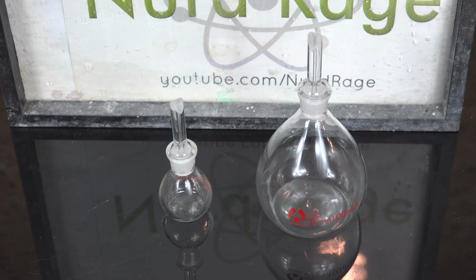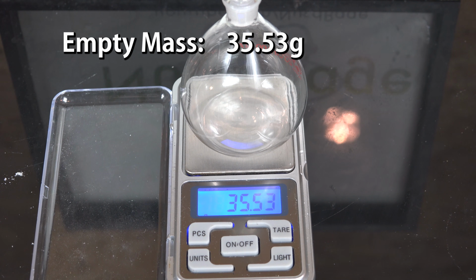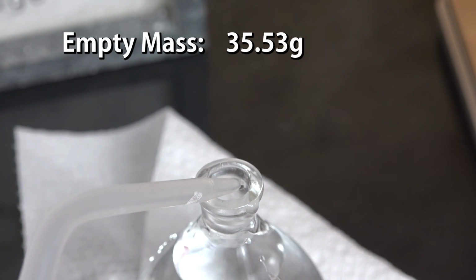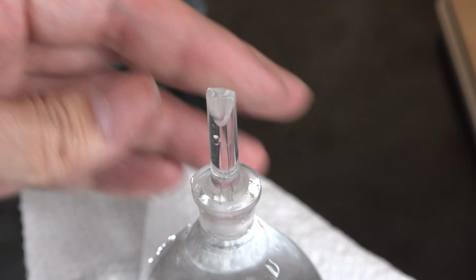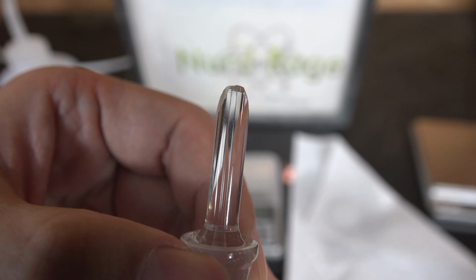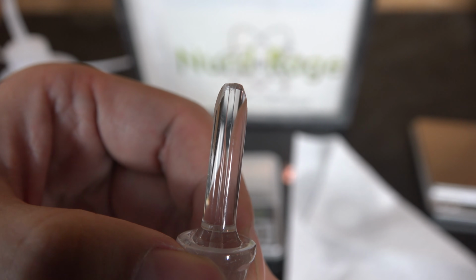To calibrate it, we're going to measure the volume ourselves using the mass of a liquid of known density. We first weigh the pycnometer, including the stopper, completely dry and empty. Then we fill it all the way to the top with deionized water, and then insert the stopper and let the excess ooze out of the sides and the hole. The excess is dabbed off. If it's properly filled, the stopper will be completely solid with liquid. At this point, this pycnometer now has an extremely precise and reproducible quantity of liquid.